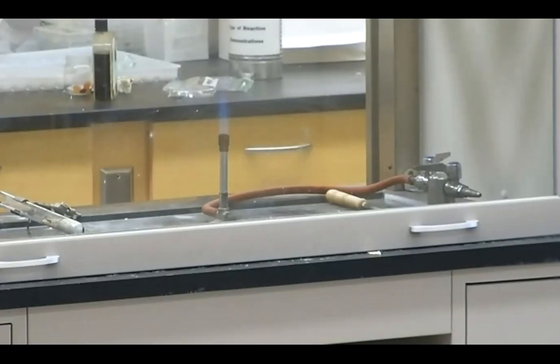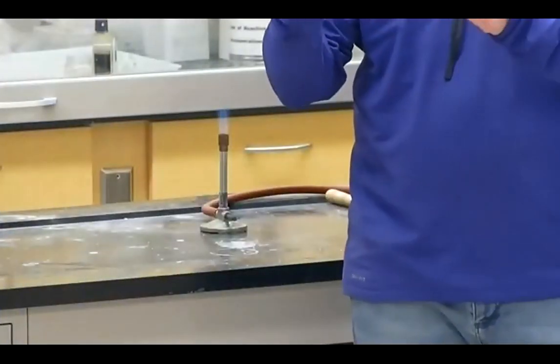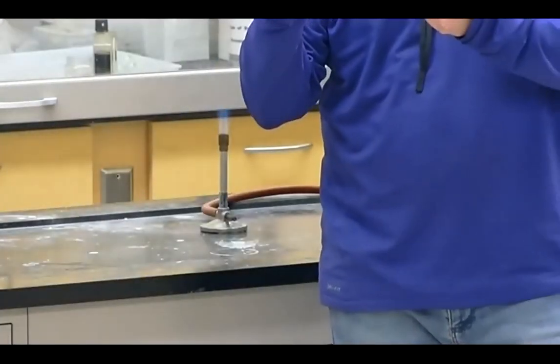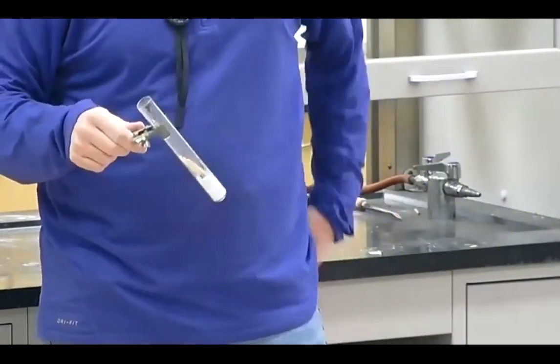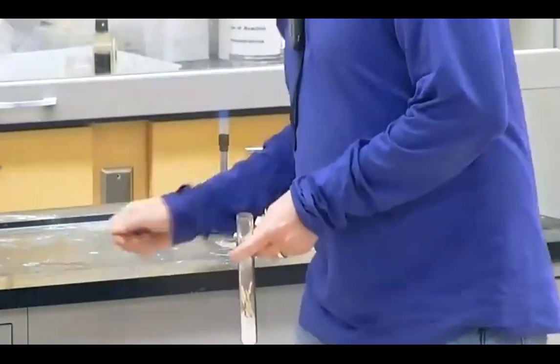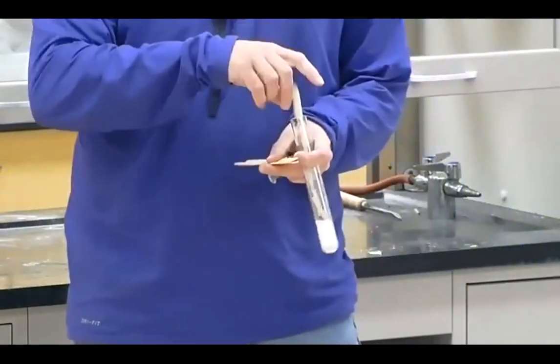What I'm going to do is I'm going to take this test tube. So if you want to come back by the fume hood, come over to this side. I'm going to take this test tube, and I've already added potassium chlorate to it. I don't know, can you see that on the screen? Nope, you can't. I've already added potassium chlorate to it. I put in some matches, but I'll put in a few more sticks. And then I'm just going to heat it.